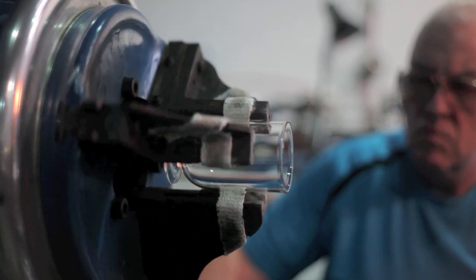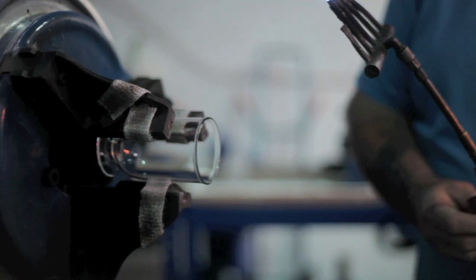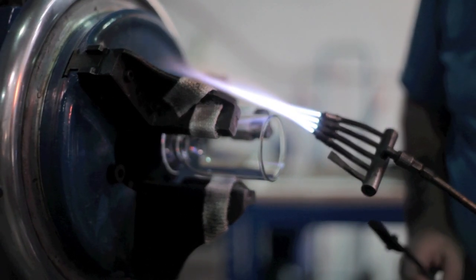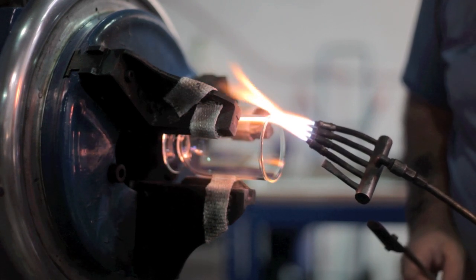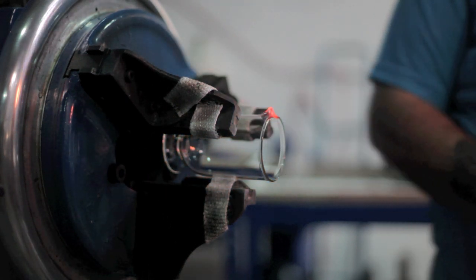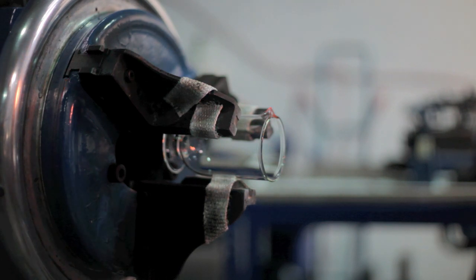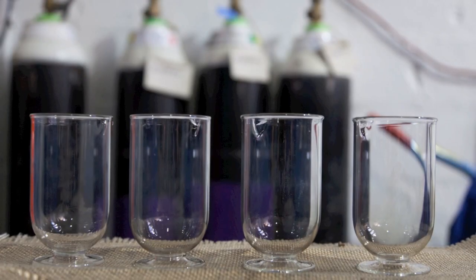And the last little part is there. A little pourer. So I have got a specially shaped tool to use for that. Just heat one part of that. Going with the tool and just lift it a little bit. And that will give a pourer. And that is one finished beaker. All exactly the same.